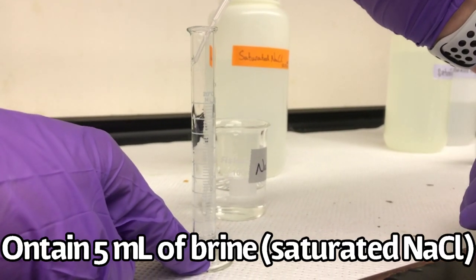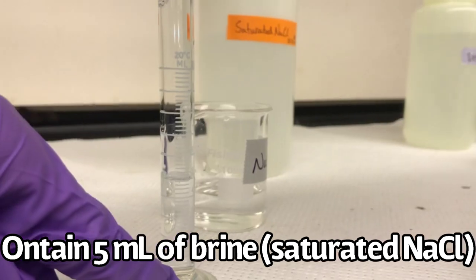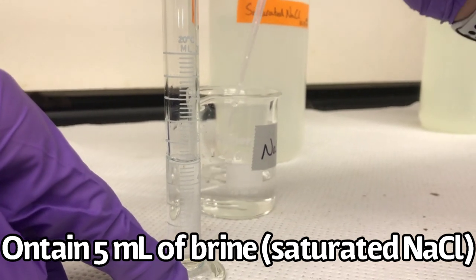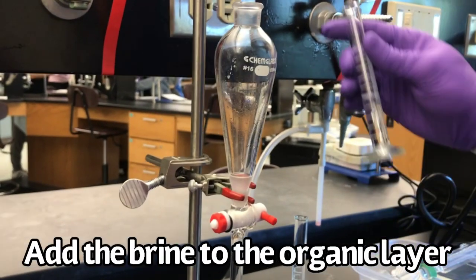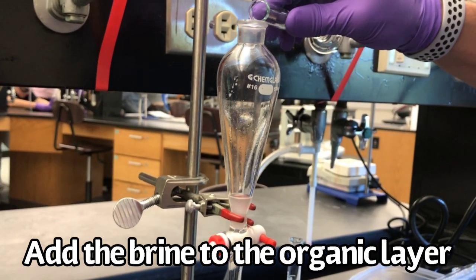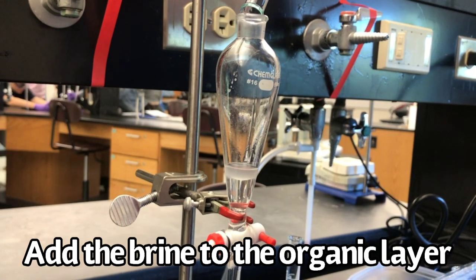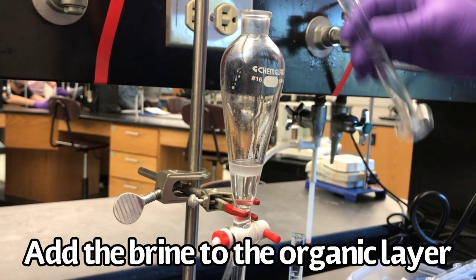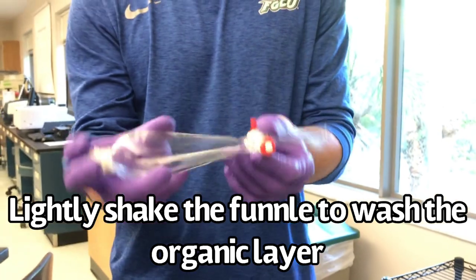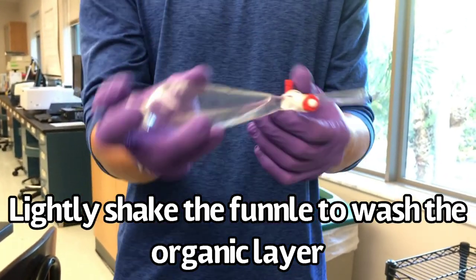Obtain 5 milliliters of brine, which is saturated sodium chloride. Add the brine to the organic layer in the separatory funnel. Lightly shake the funnel to mix the solution, which will wash the organic layer.